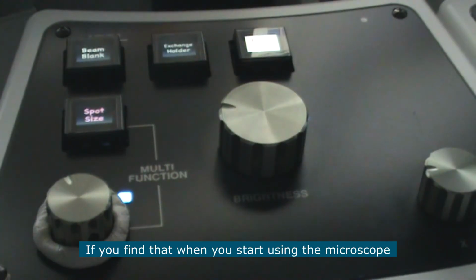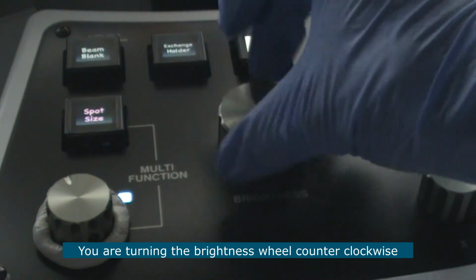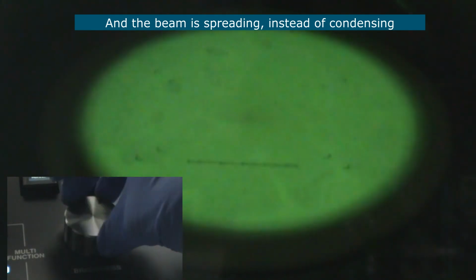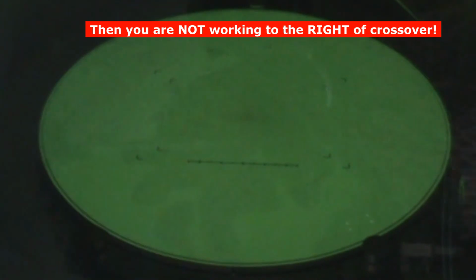If you find that when you start using the microscope, you are turning the brightness wheel counterclockwise and the beam is spreading instead of condensing, then it means you are not working to the right of crossover.